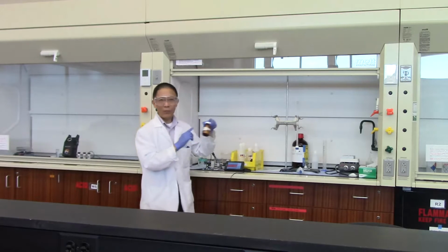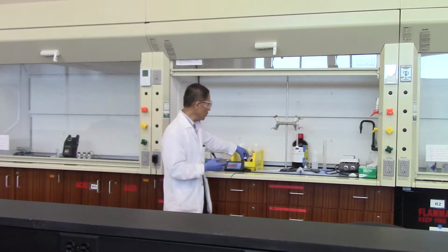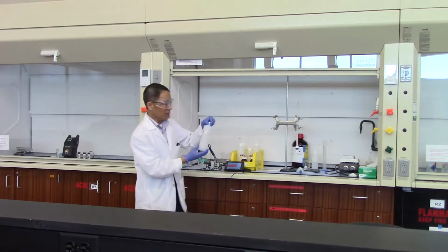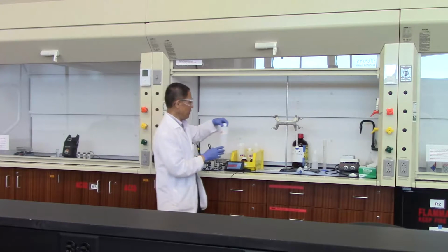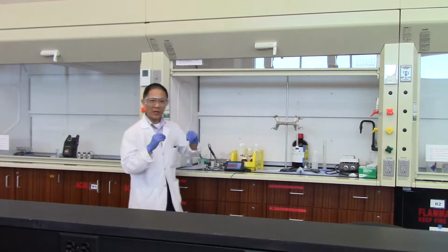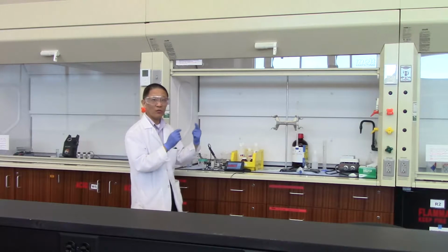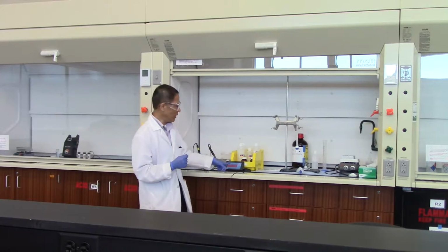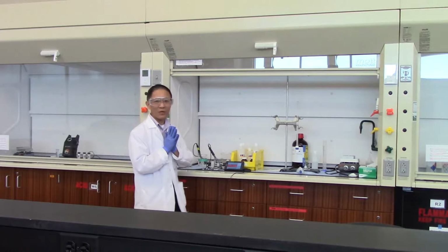You get 1.45 grams of sodium acetate, and you will take 100 milliliters of the 1 mole per liter acetic acid solution, and then you put that 1.45 grams of the sodium acetate into that 100 milliliter solution. If you test the pH there, you should end up with a pH somewhere around 4.0. 4.05, somewhere in that neighborhood.